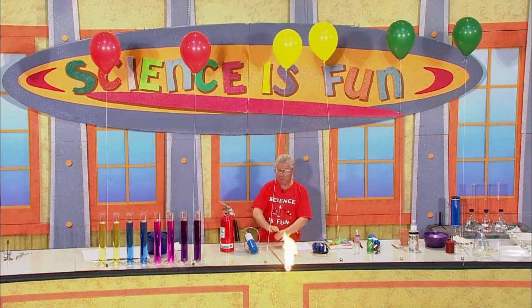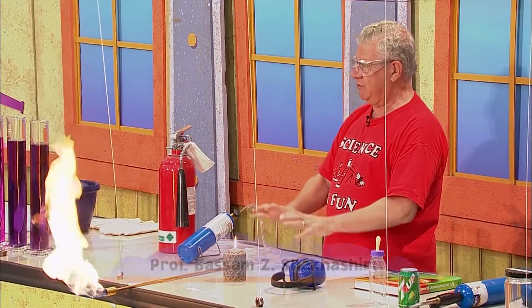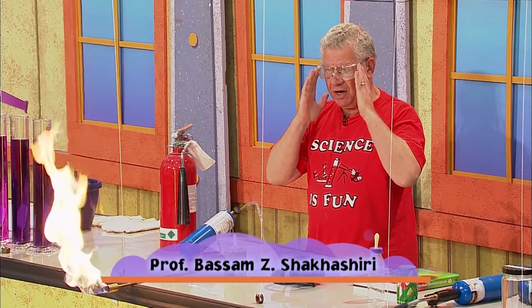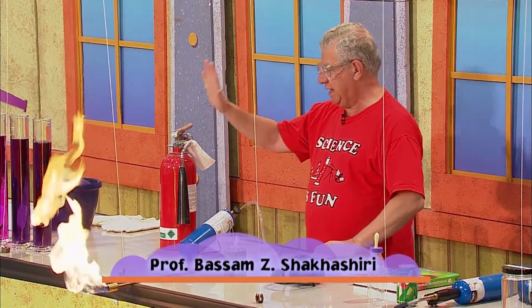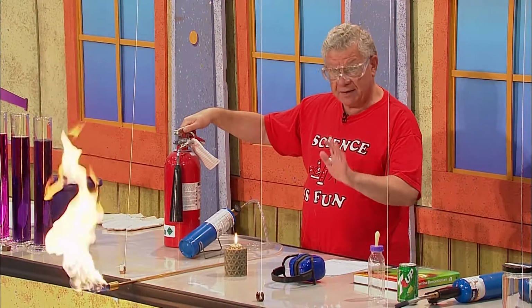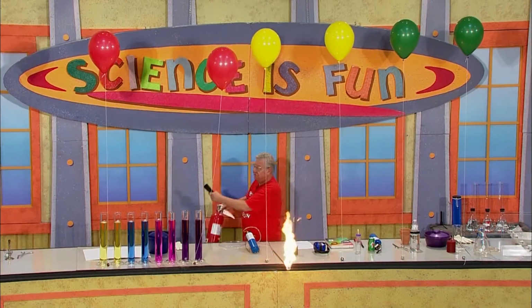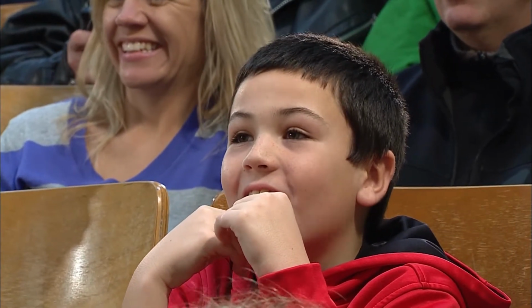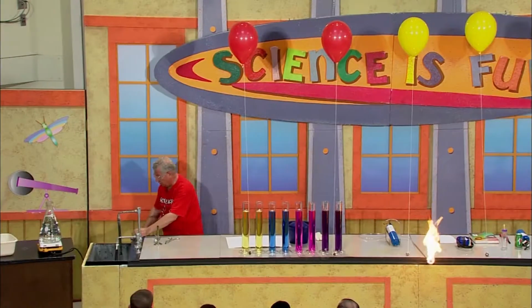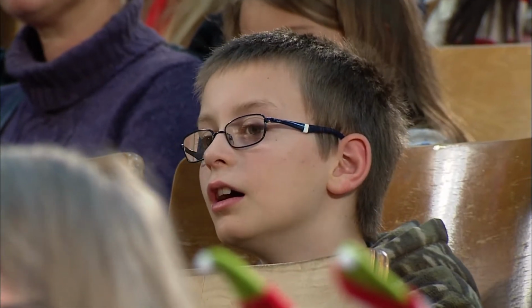In my lab, whenever we do experiments, we obey all the safety rules. I want everyone to notice that I have my goggles on, and I also want you to see that we have a fire extinguisher ready to be used just in case something goes out of control. We're not planning on anything going out of control, but we have it as a safety precaution, and it is really ready to be used, just like that. I'm going to put it right here where you and I know where it is in case it is needed.